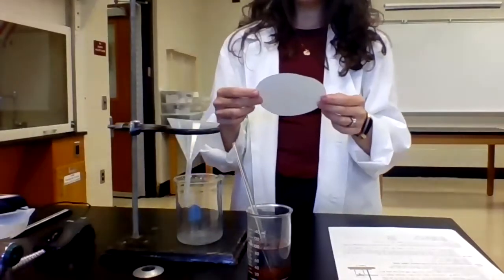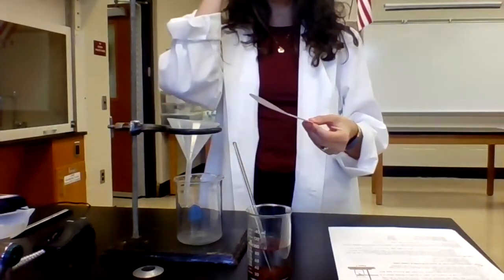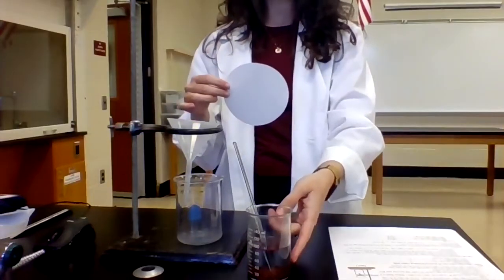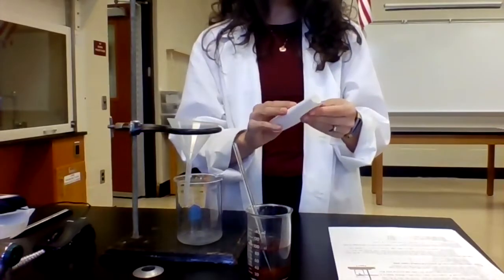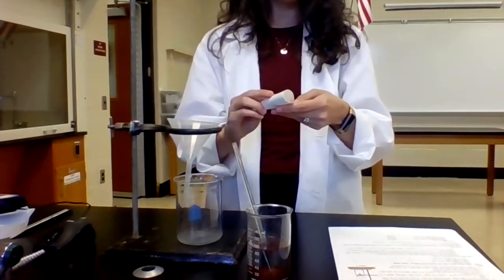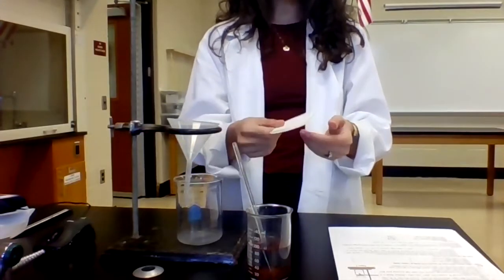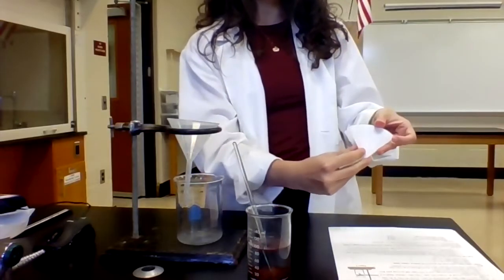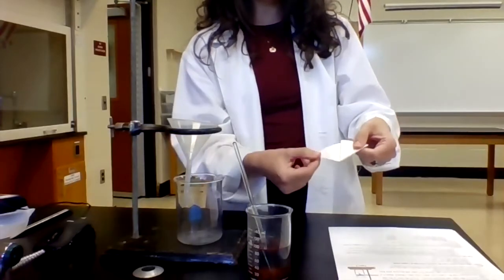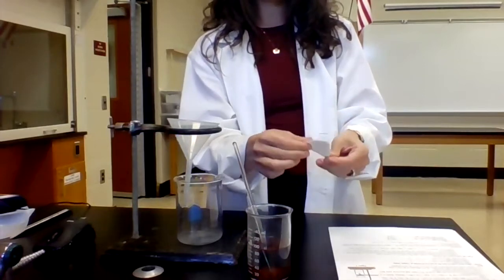And then what I'm gonna do is I'm going to do what we call flute the filter paper. So it's a way of folding the filter paper. And the point of it is by creating the folds, you create more surface area for our product to stick to. So the way that you flute filter paper is you first fold it in half and then in quarters, like so. But then what I'm gonna do is I'm gonna take it and fold it back on itself, like this. And then I'm gonna do the same thing over here, like that.